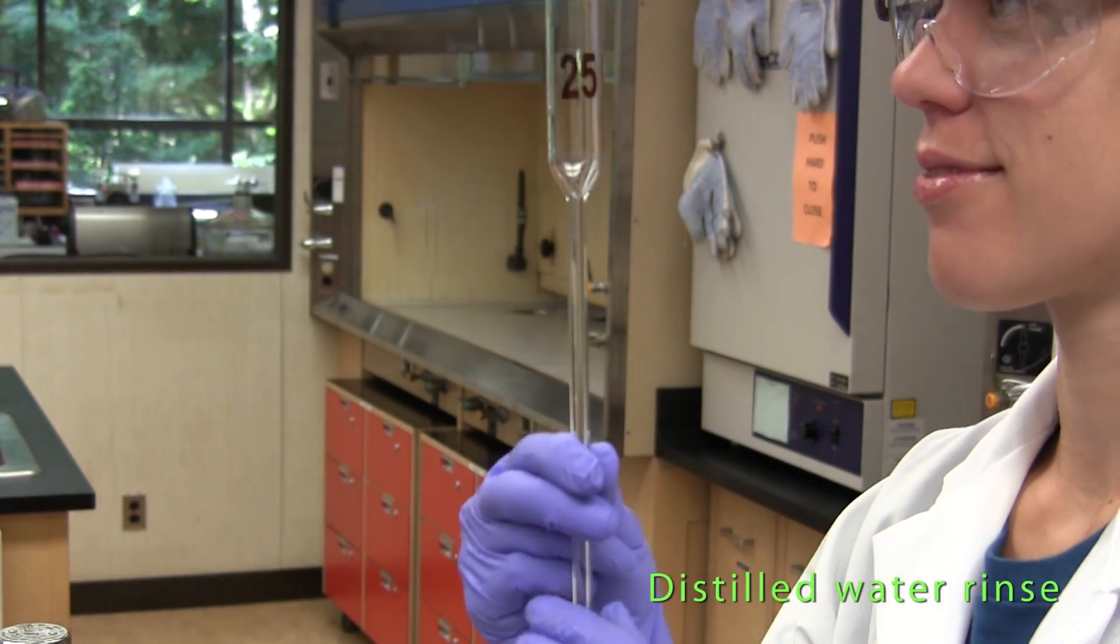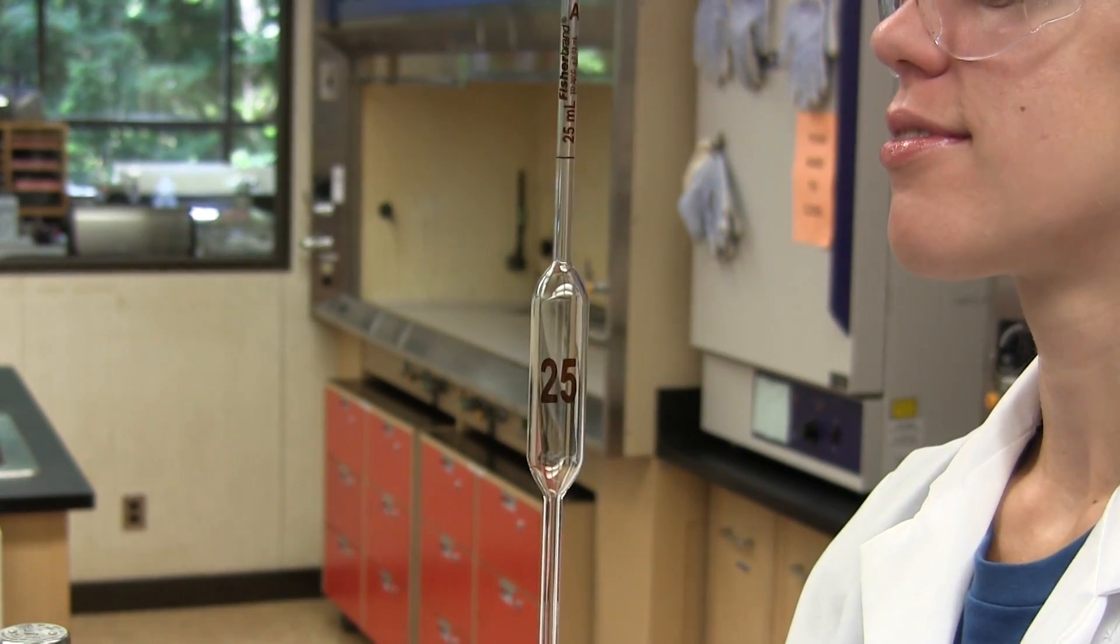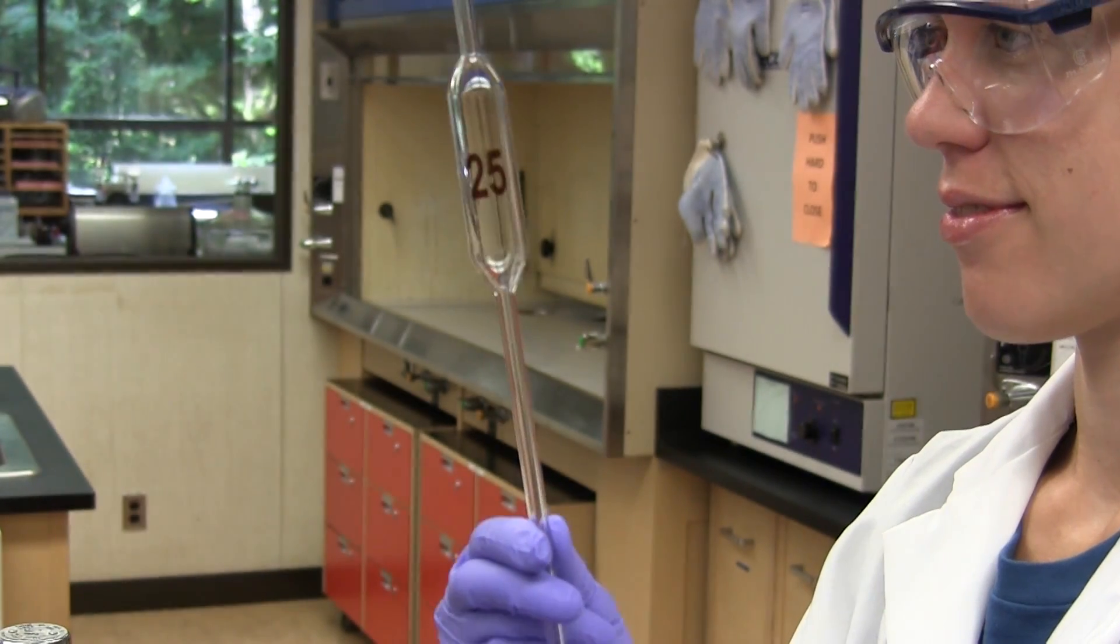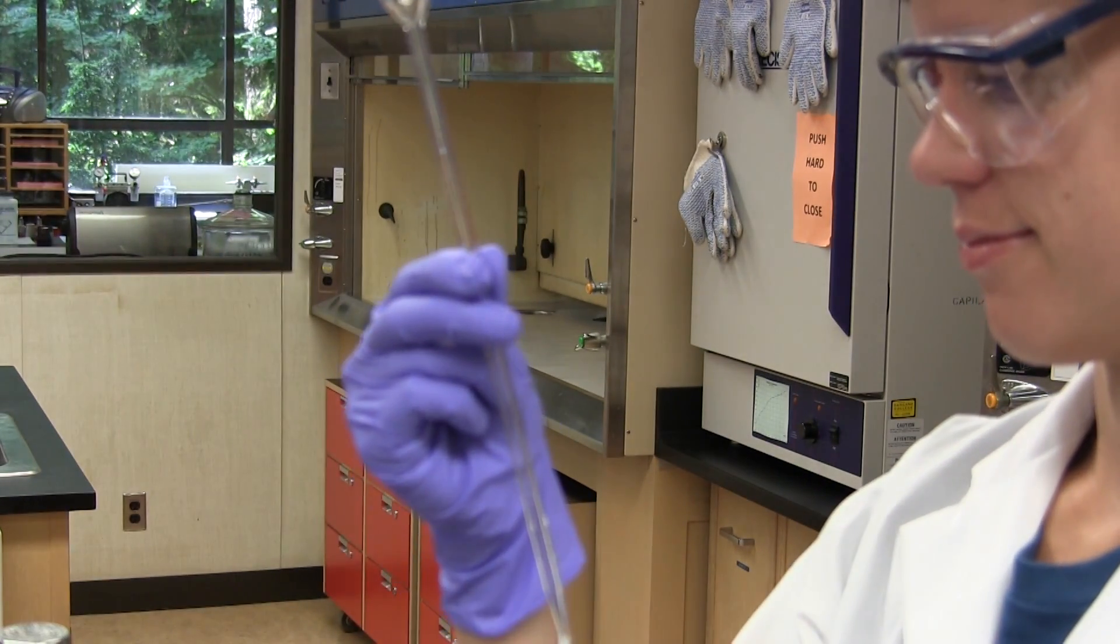The inside of the pipette is checked to make sure that it drains freely and that there are no droplets of water sticking to the inside surface. This indicates that the pipette is perfectly clean.